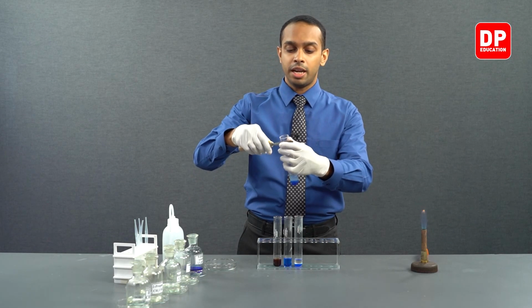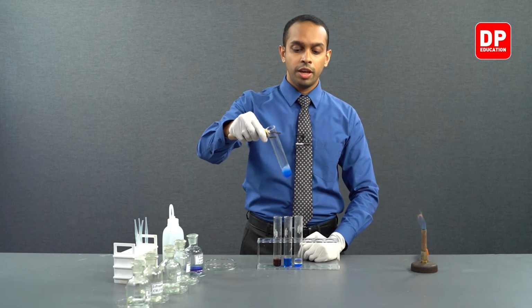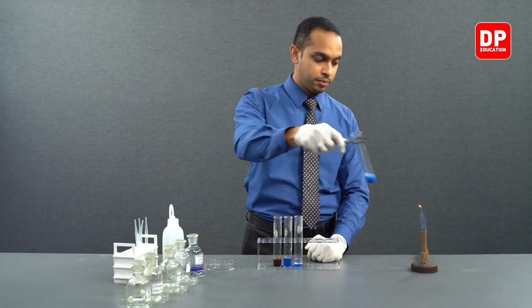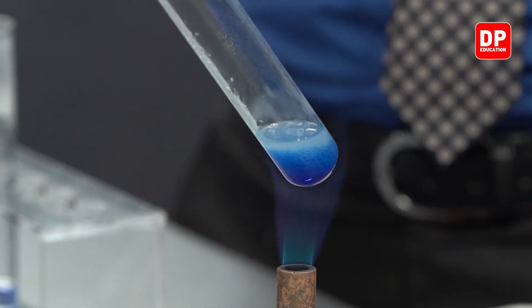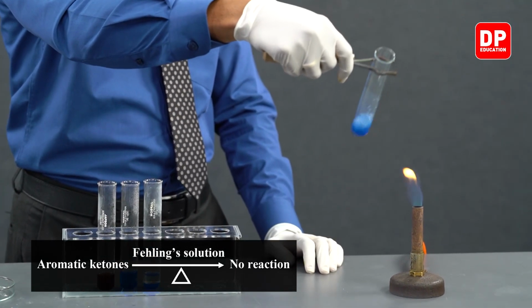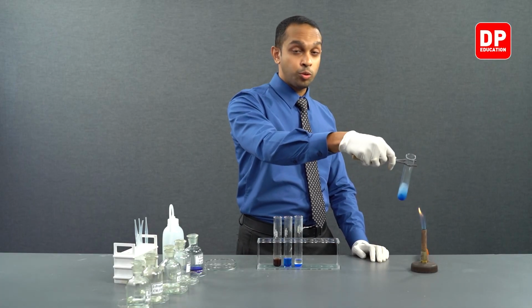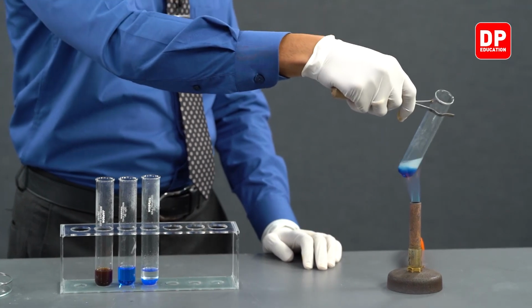And then we'll heat it up with the help of a Bunsen burner. If there is any reaction, we will see a color change in the Fehling's solution layer. When you are heating it up, please be very careful. These are all organic solvents. They will quickly evaporate as well as quickly boil off. It could result in a splash hazard.